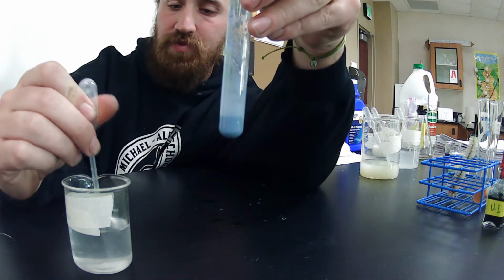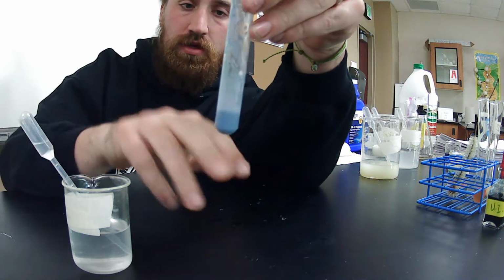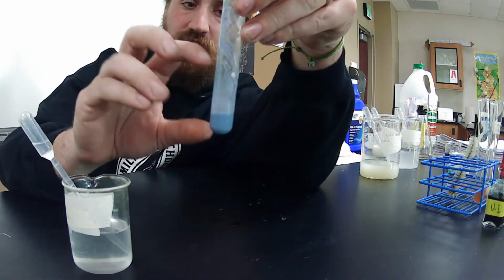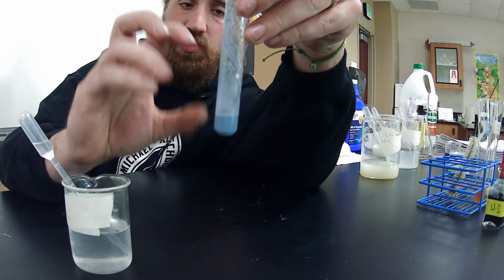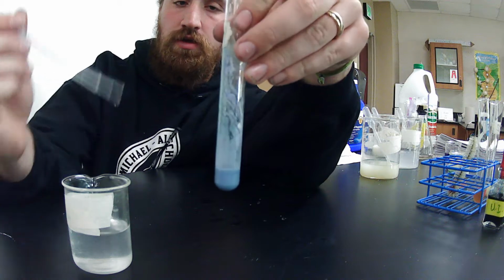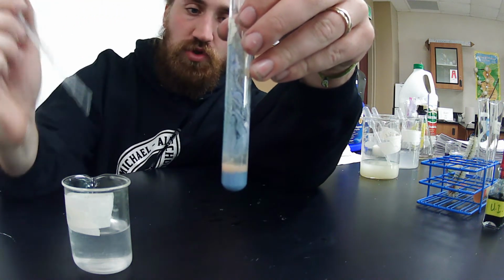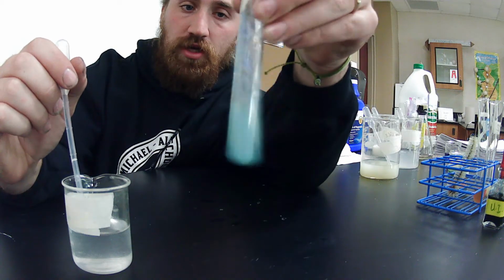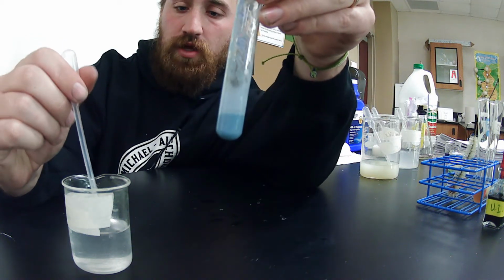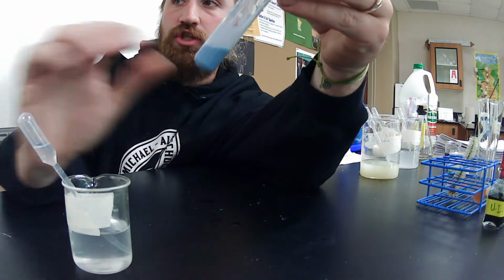So I'm adding something acidic, and that buffer knows that. It knows that this is basic, and I'm adding something acidic, so it turns partially acidic, but it's going to buffer, and it's going to go back to basic, try to maintain homeostasis. So I'm going to do this one more time. A couple things there, keep adding. You see it turns orange, turns red. I shake it up, it turns green, it turns back to blue. Now, this is achieving homeostasis. It is staying here. The buffer is doing its job.